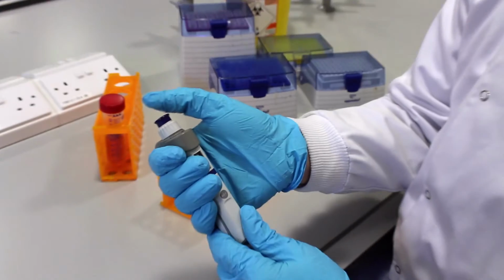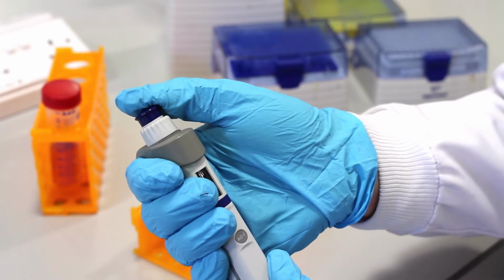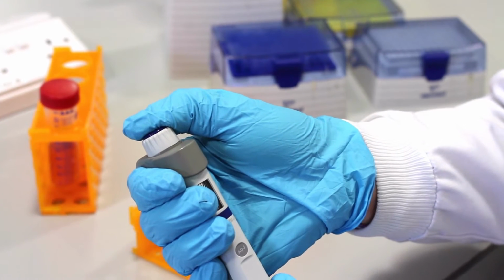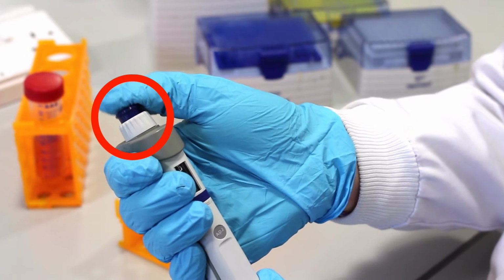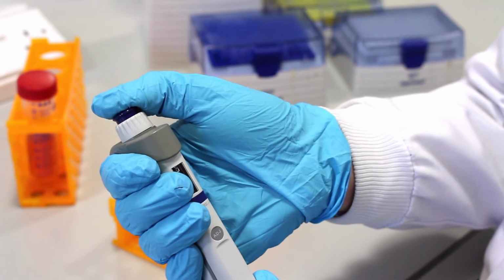When you push down this particular button on the top, you'll find you meet a resistance, a catch. You have the capability to go beyond this, if you wish, with a full depression of the button to a second point. But it's so important that you recognize where that first catch is. You see there the button is meeting a resistance and it's stopping.